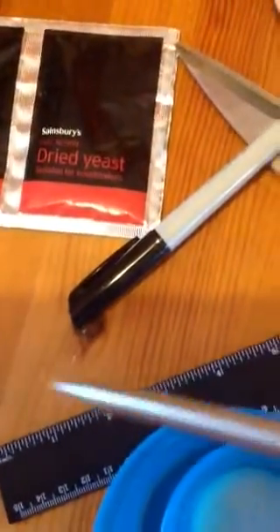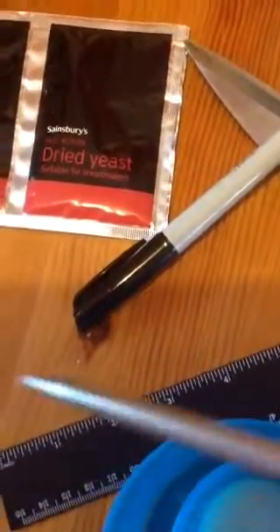Once you've left it for 30 minutes, students can check the temperature of it. You'll need a thermometer — I've got a digital thermometer off eBay which was three pounds including delivery, which I thought was quite good. Make sure students know to stir up the suspension before they take the sample. This is currently reading about 23 degrees, so it will be a little bit slower than at 30 degrees. Next you need a syringe — a five millilitre syringe.